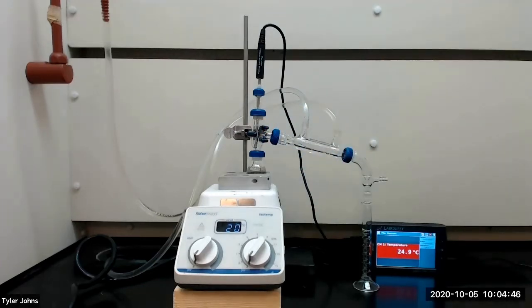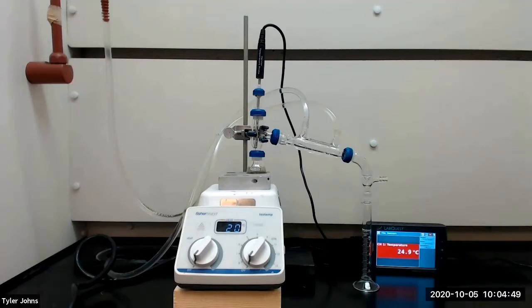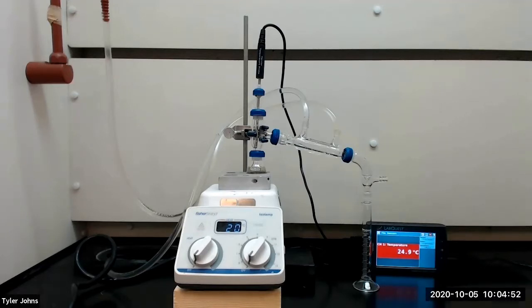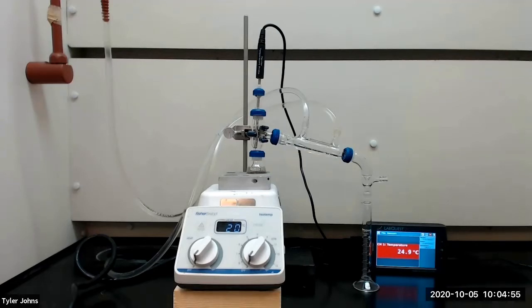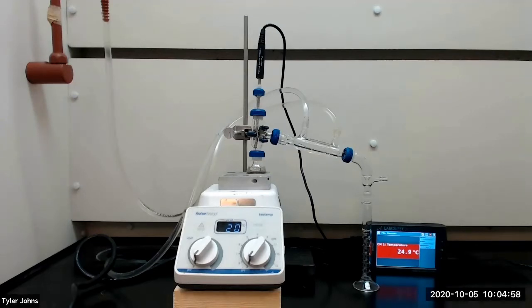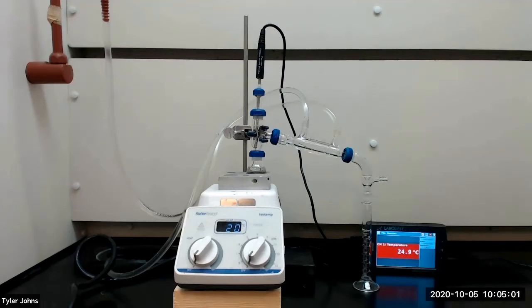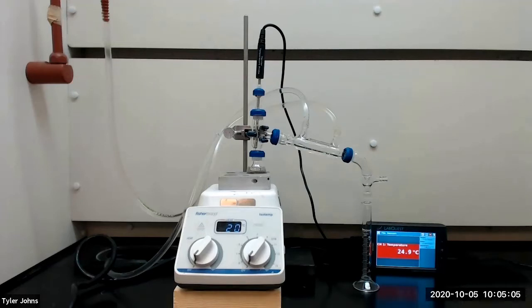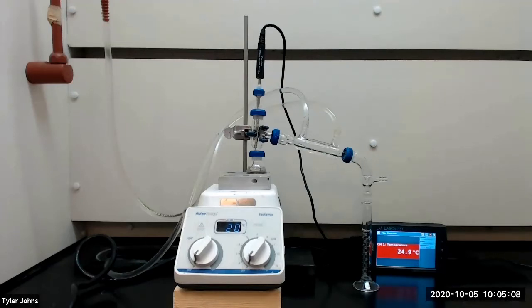We will now begin our simple distillation by turning on the hot plate and heating our unknown liquid mixture in our 10 milliliter round bottom flask until it boils rapidly. We'll then adjust the hot plate so that we collect one drop of distillate every five seconds. Beginning at a volume of 0.5 milliliters in our graduated cylinder, we will record the temperature every 0.5 milliliters.